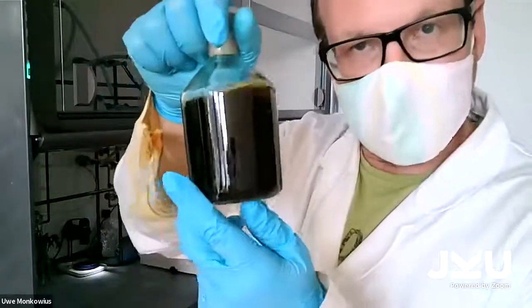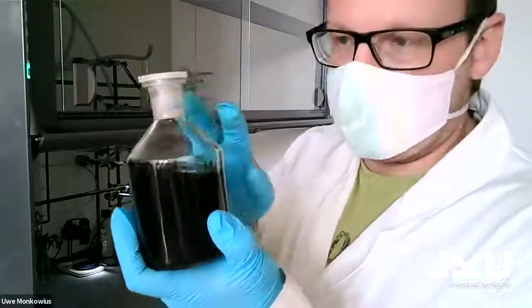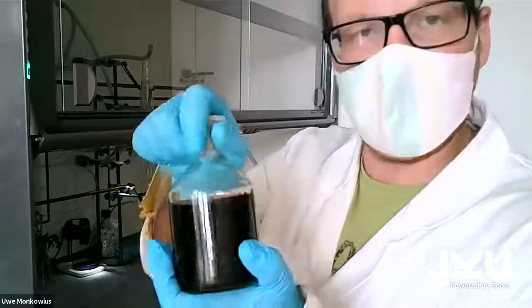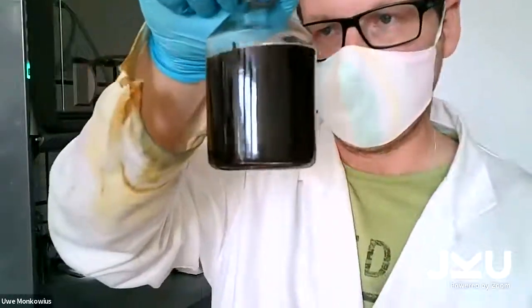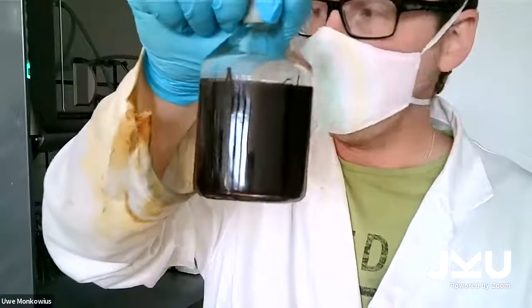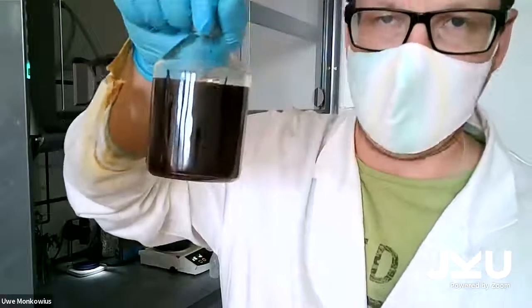What is oxidizing the dye again? It's the oxygen in the air. When I shake the bottle, the oxygen that's in the air inside the bottle goes into the solution and oxidizes the dye again to its green form. But because the glucose and the sodium hydroxide is still inside the bottle, you will see the bottle changing back to red, and then after a while changing back to yellow.